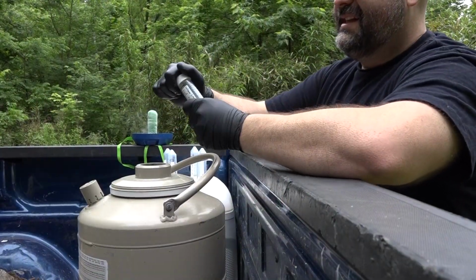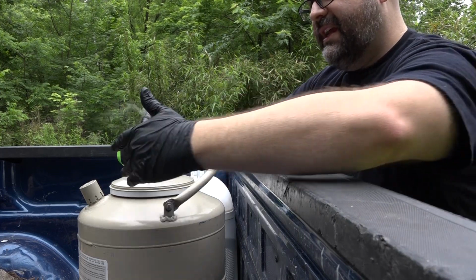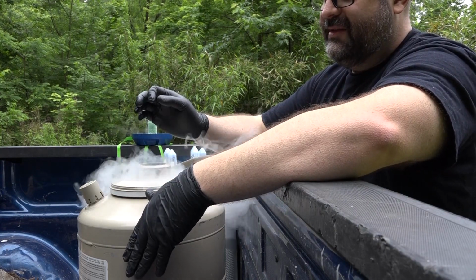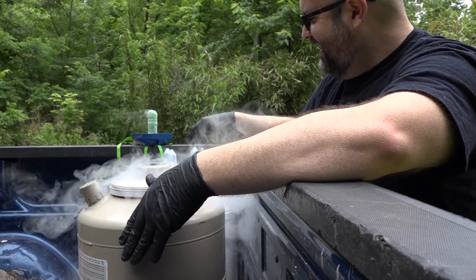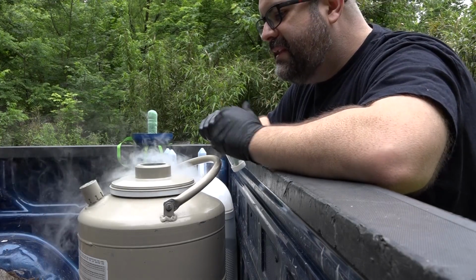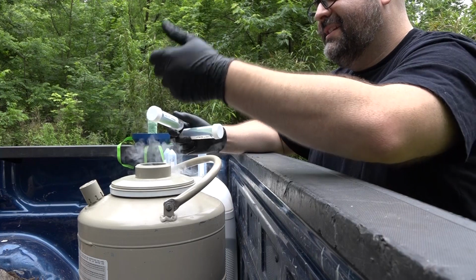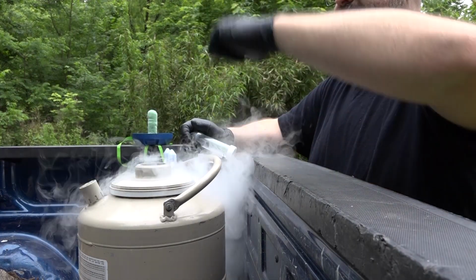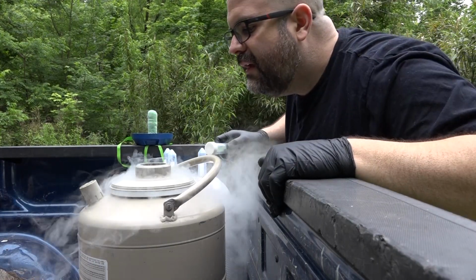Just going to make sure this is tight before we drop it. We'll drop it in, and this has a nice jacket on it, so it freezes it real quick. Is it like a pool of freezing stuff? Yeah, this is a 10-liter container of liquid nitrogen. It's been evaporating since yesterday, but you can hear it bouncing. There's still plenty in there, which is good.